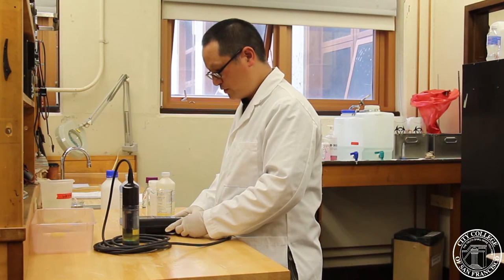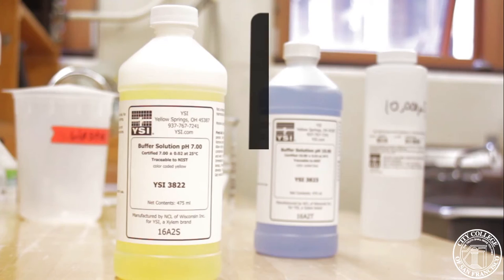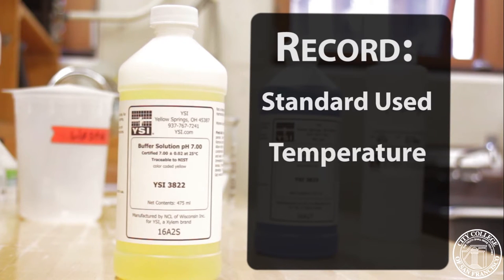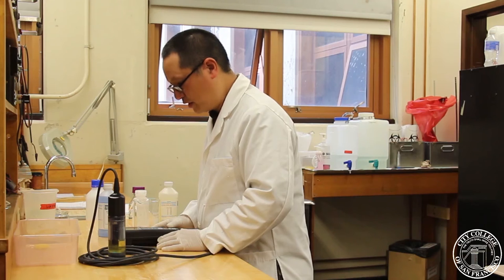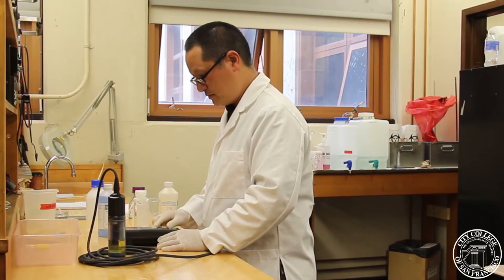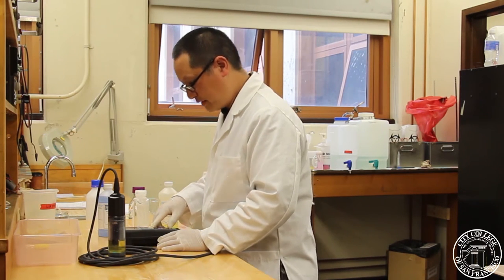And now, we want to record what we see. Our calibration value is reading at 7.01, which is good. So, now we can accept that calibration.